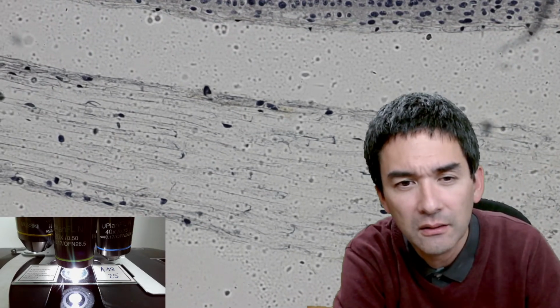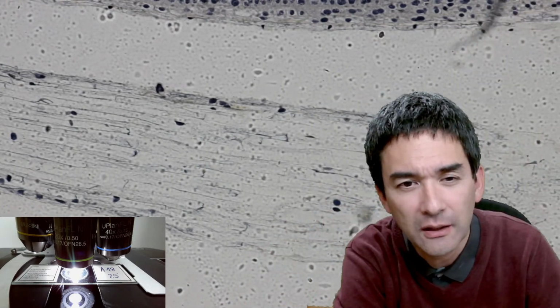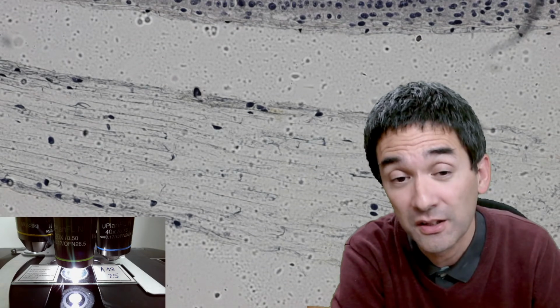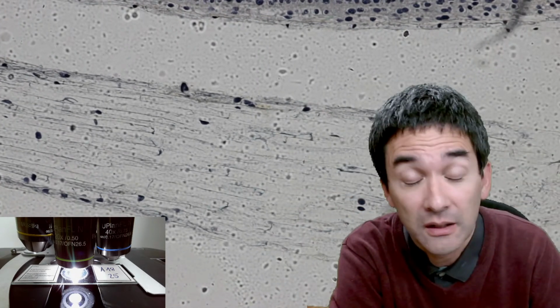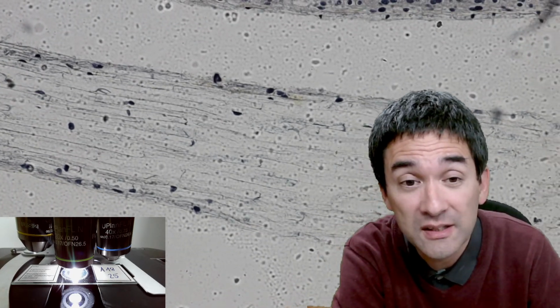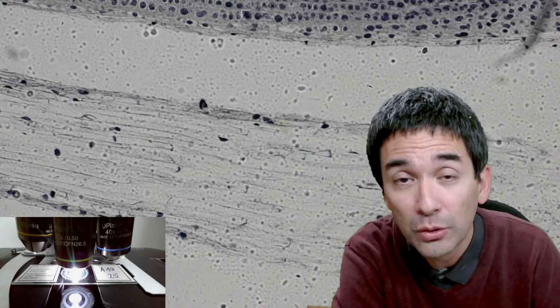Not every cell has a nucleus. It's kind of difficult to see the cell wall anyway, but not every cell over here has a nucleus. I mean, you could say, well, the cells are long and thin, and therefore the density of nuclei is also less. But honestly, there seem to be some cells that don't have a nucleus, and the reason is because we're looking at a thin two-dimensional cross-section.